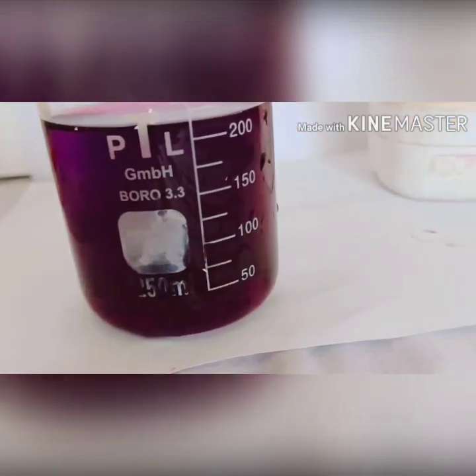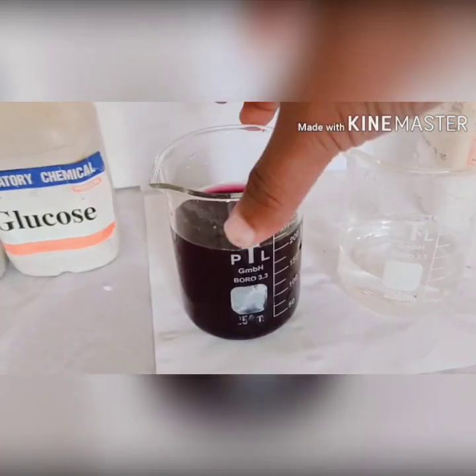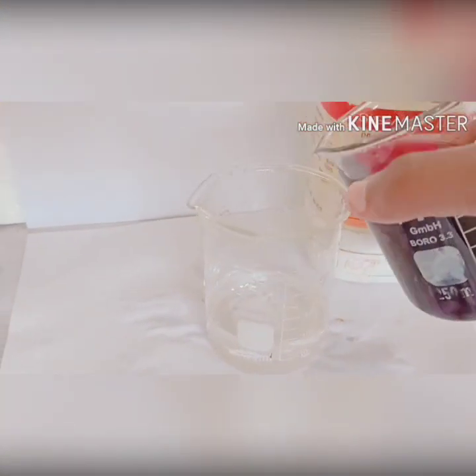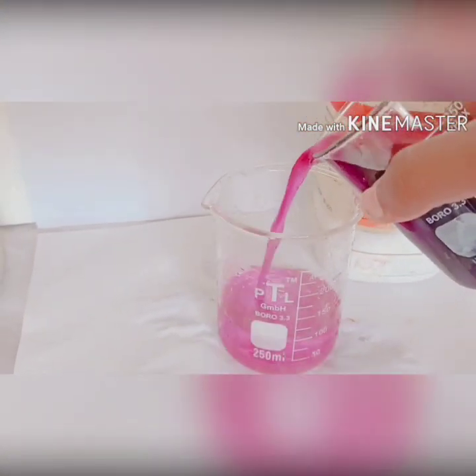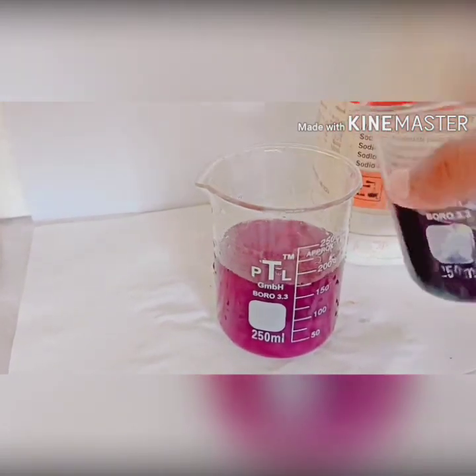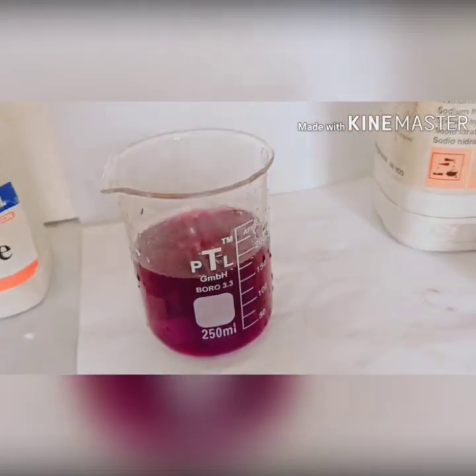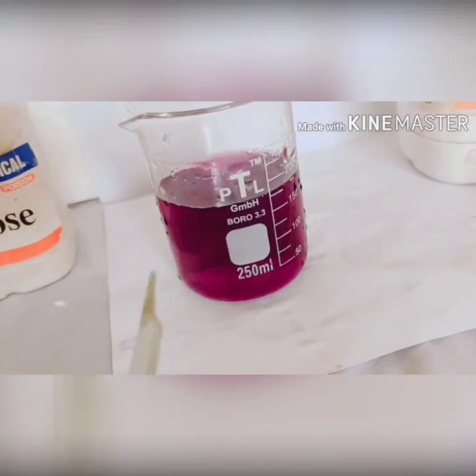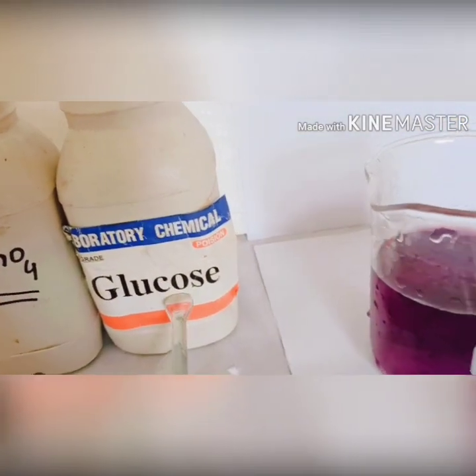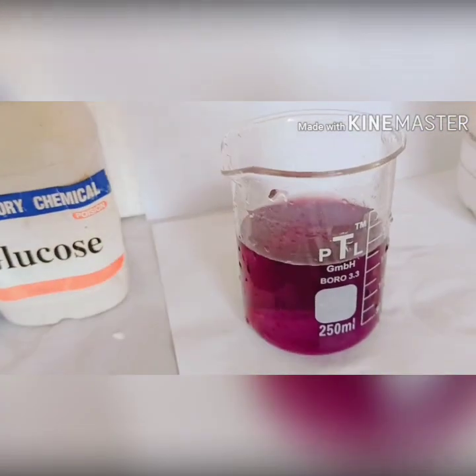For this we will add some water so that you can see the color properly. We take some water and put the potassium permanganate solution into another beaker. Now you can clearly see the color, which is purple or pinkish. Then we add some glucose.